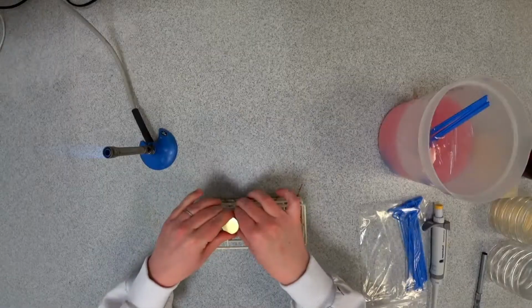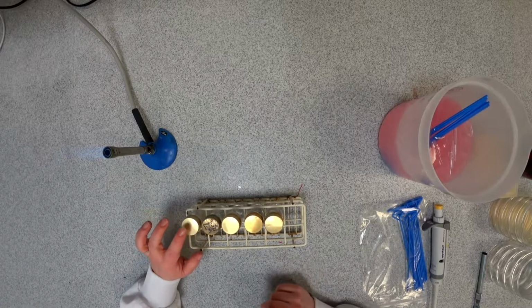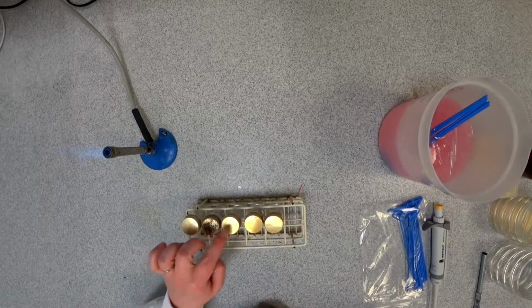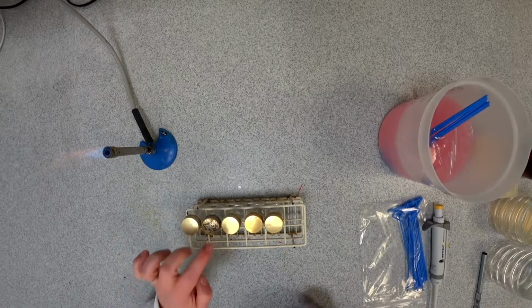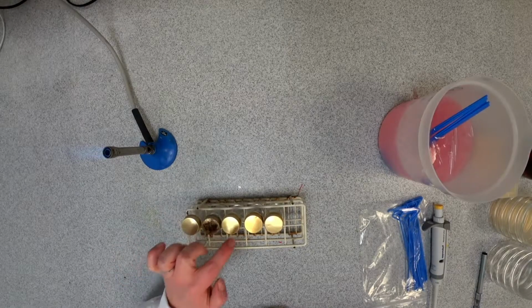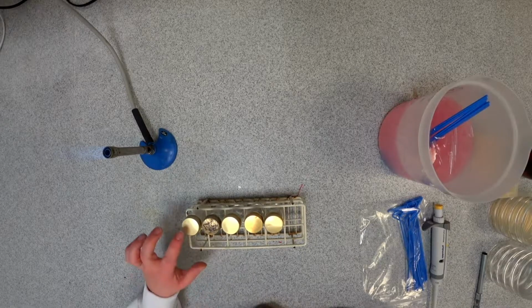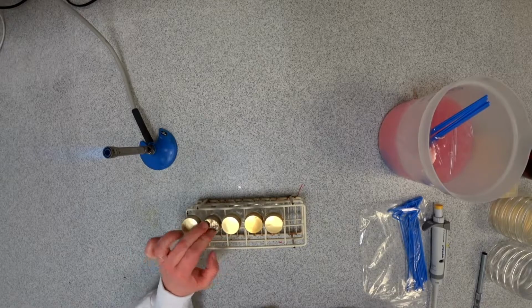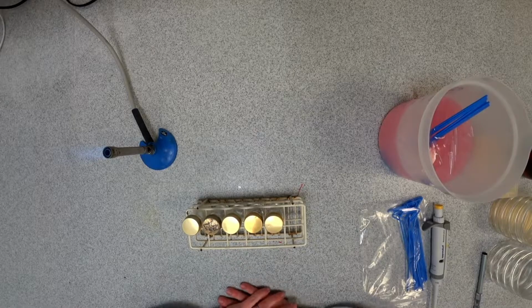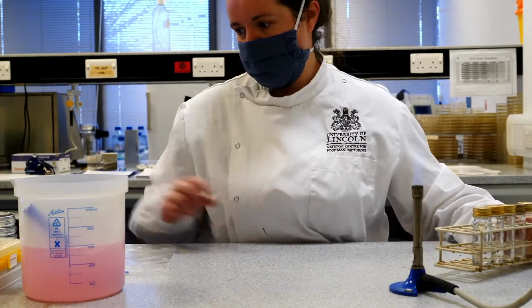So now I have this dilution of microorganisms from 10 to the minus 1, which was the original food sample that I prepared through stomaching, minus 2, minus 3, minus 4, minus 5. What should happen in this dilution, of course, is the number of bacterial microorganisms in each should be 10 times fewer at each step of dilution. So let's say we have 1,000 microorganisms in here per milliliter. We'll have 100 in here, 10 in here, 1 in here. And we'll be able to measure that then by putting these microorganisms onto microbiological growth media.